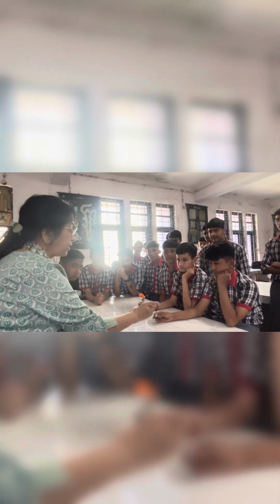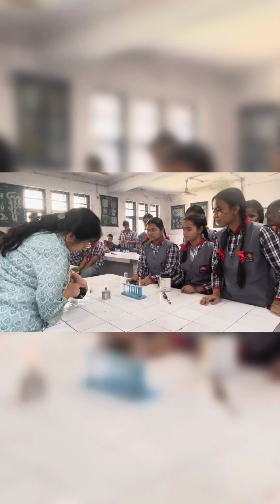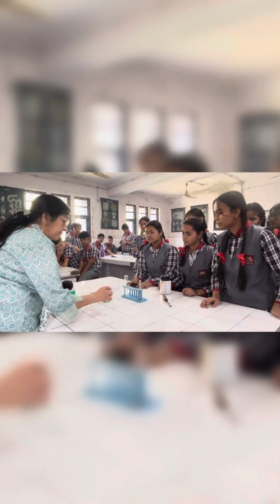So that is how you have to explain. We are switching over to the second activity, and they are going to do it now. I have given them a salt. They will explain about it.